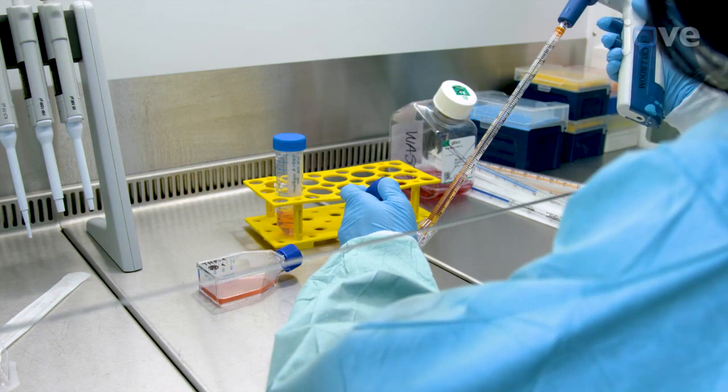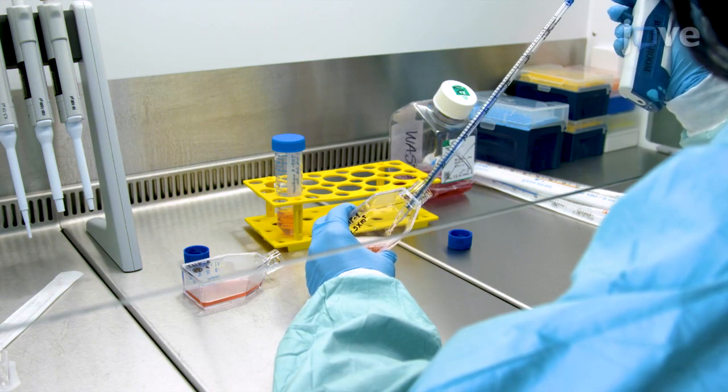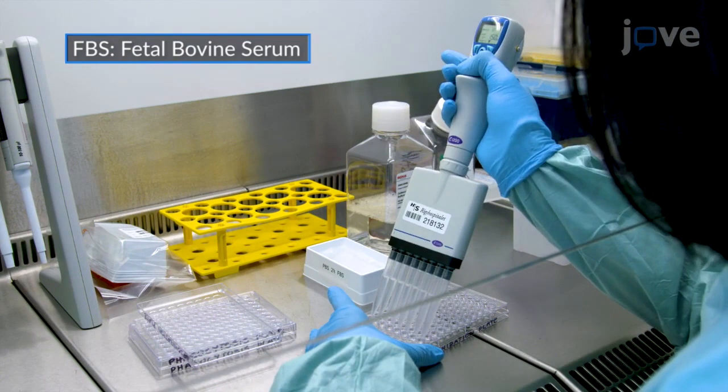To set up a THP1 cell culture for a phagocytosis assay, the day before the experiment, seed the cells in a 25 centimeter squared culture flask at a concentration of 2.5 times 10 to the fifth cells per milliliter in THP1 cell culture medium. On the day of the experiment, at least one hour before the experiment, block two round bottom 96-well plates with 150 microliters of sterile 2% FBS in PBS per well.